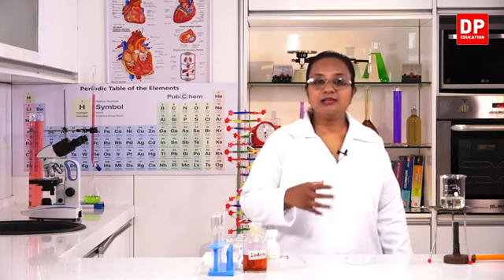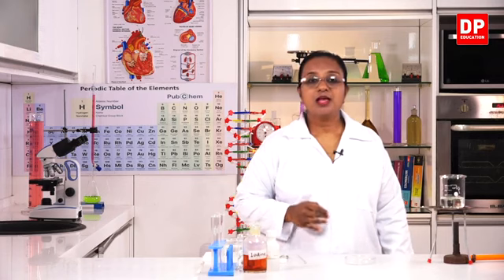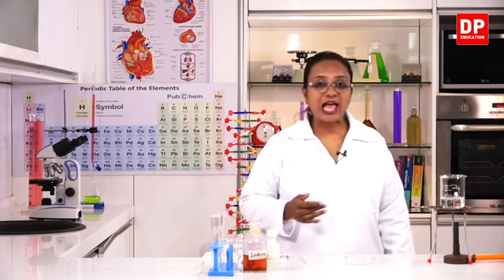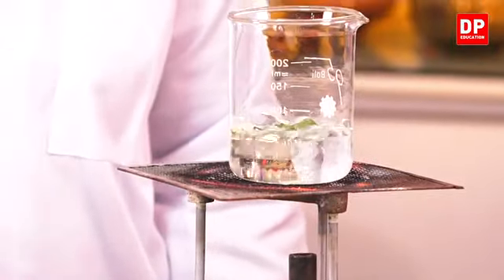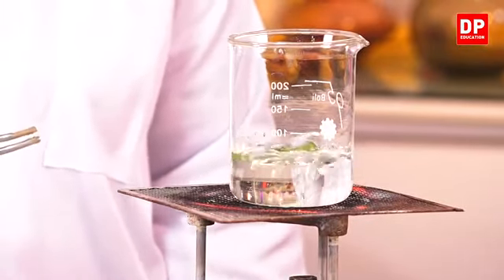So we will have to wait for some more time until it really becomes pale in color. And you know the reason for doing this first step. The leaf cells are not permeable. So by boiling it, we increase the permeability of the cell by damaging the cell wall and the cell membrane. As you can see students, the water is boiling and the leaf is getting boiled, so the permeability is increasing.